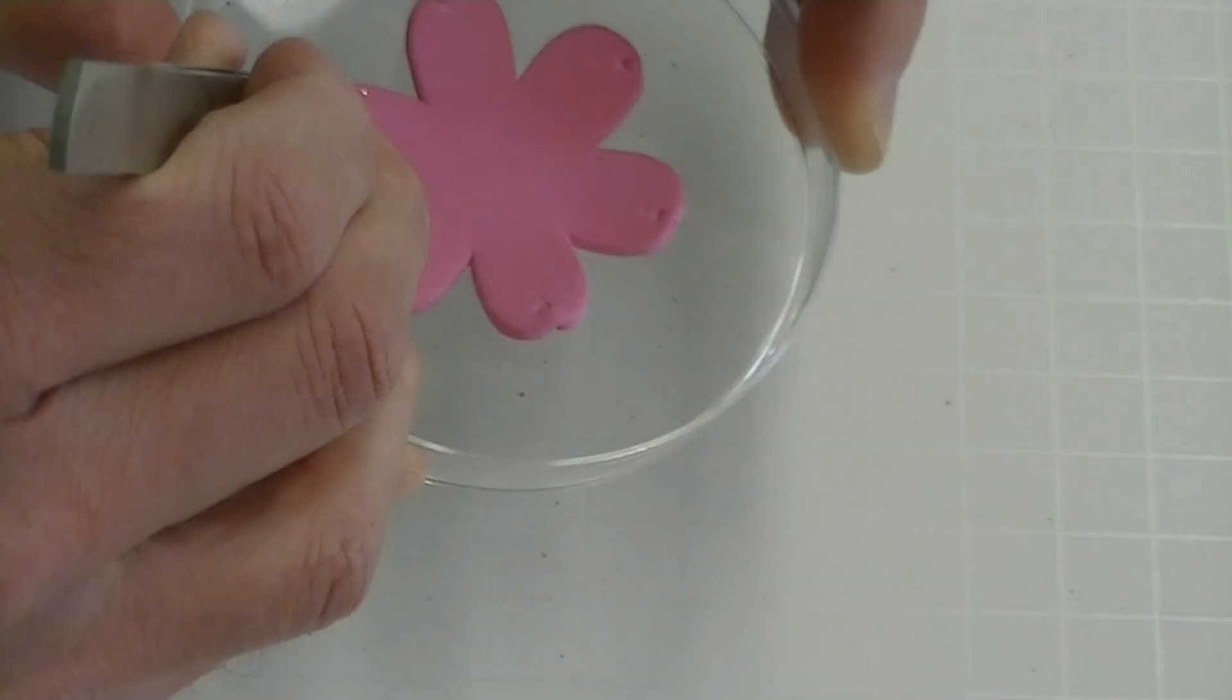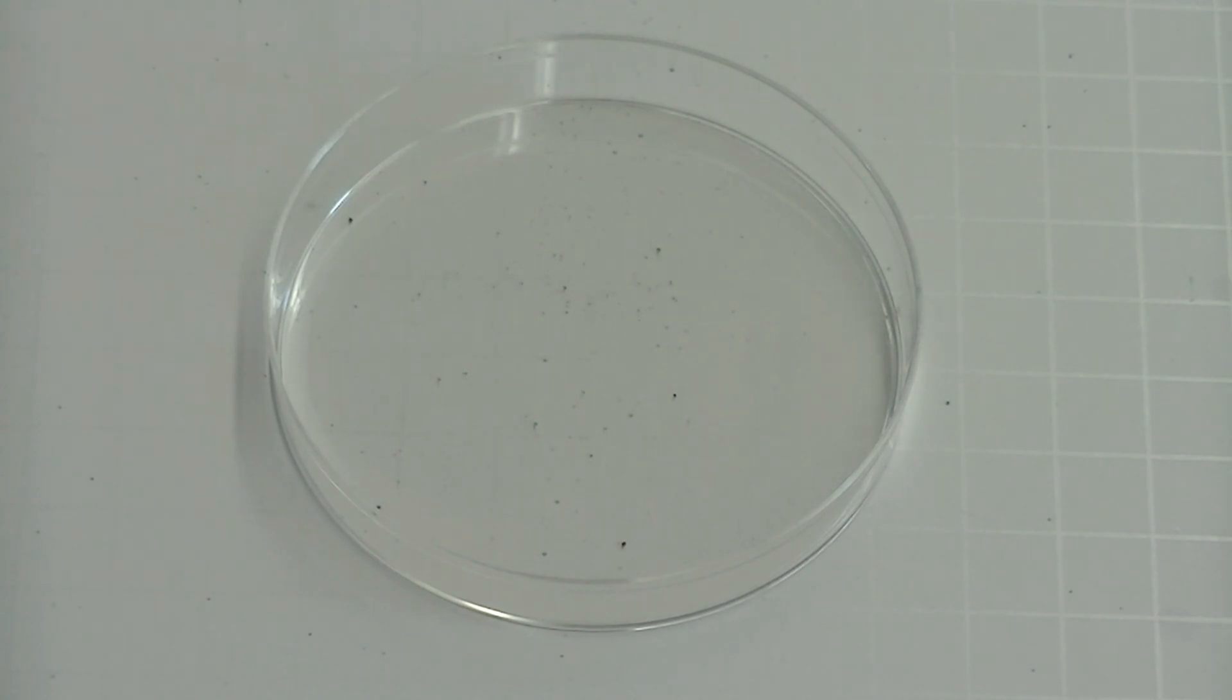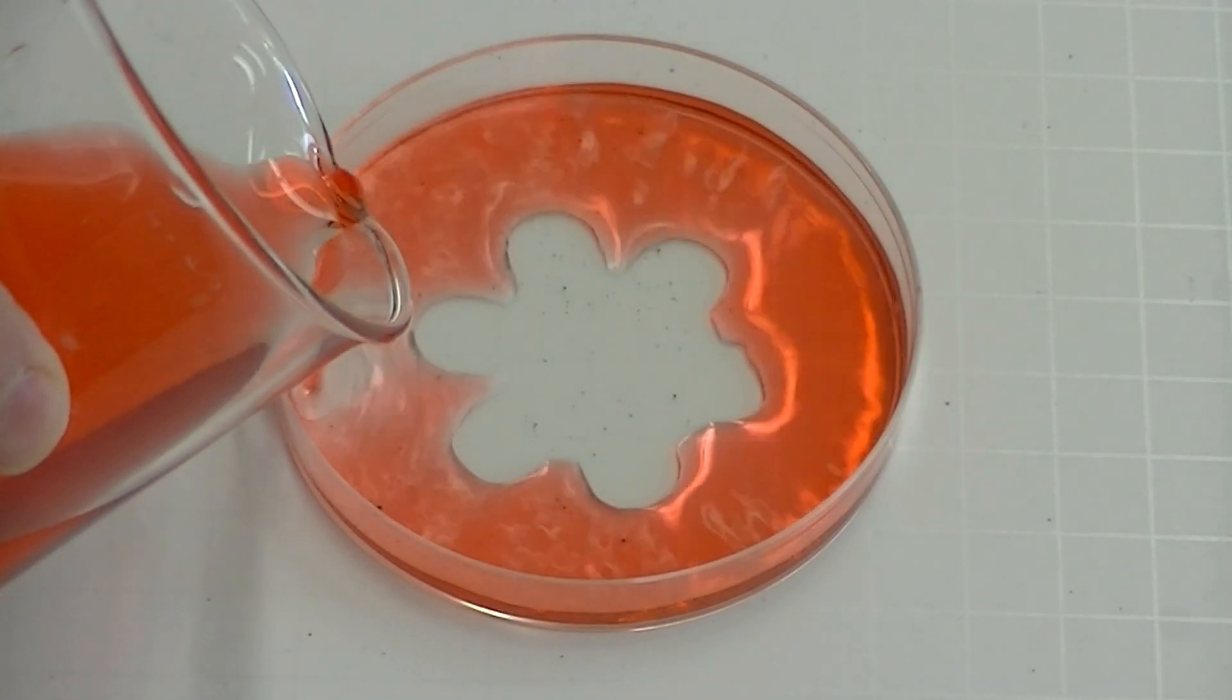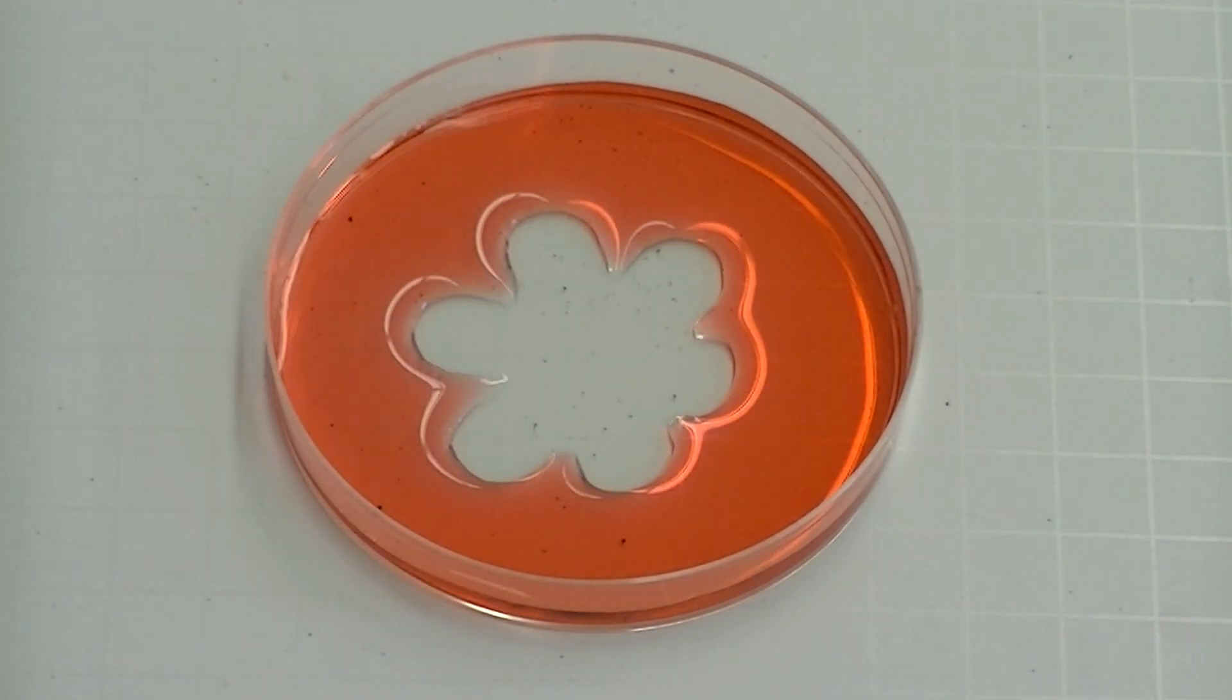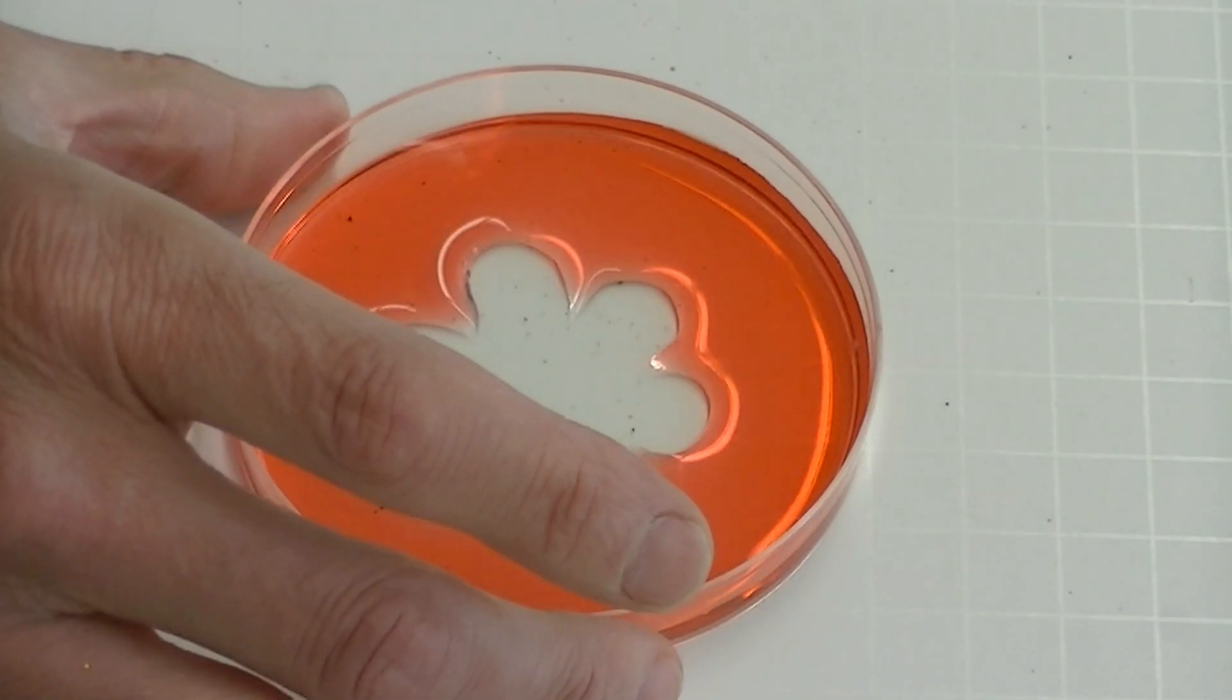Now that the dish has been treated let's remove the sticker and see what happens when we add water to the dish. We note that water adheres to the treated portion of the dish but does not adhere to the portion of the dish that was protected by the sticker.